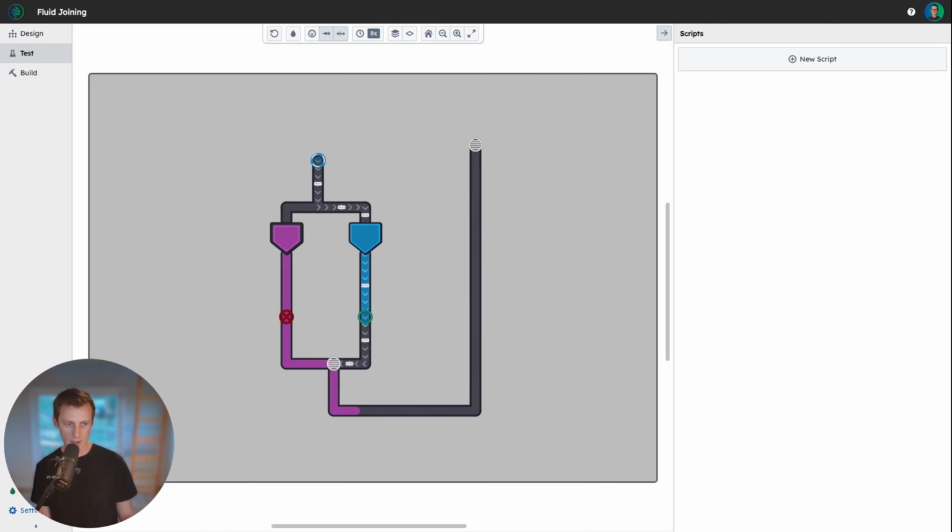Now we see that the first fluid slug splits at the intersection and does not move until the next one comes along, sealing the hydrophobic vent and pushing it out. Cool, we just learned how to join fluid slugs and remove an air gap using a hydrophobic filter.